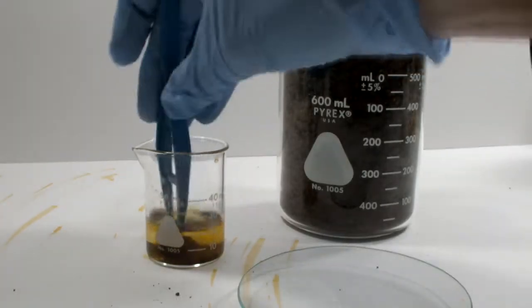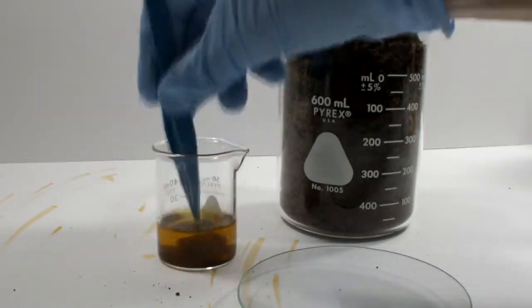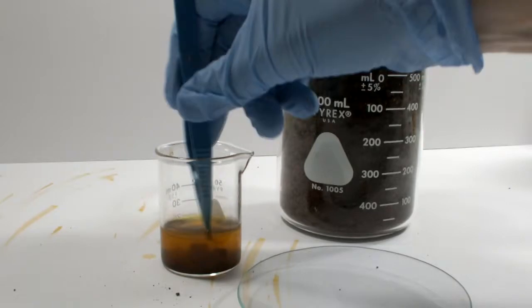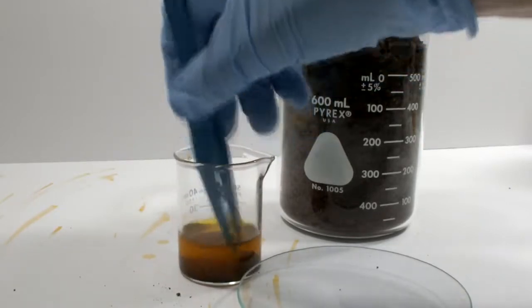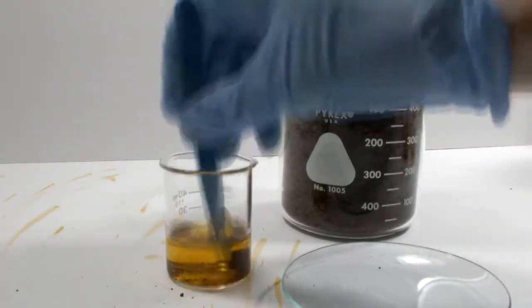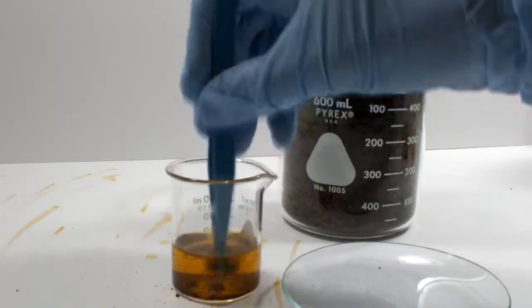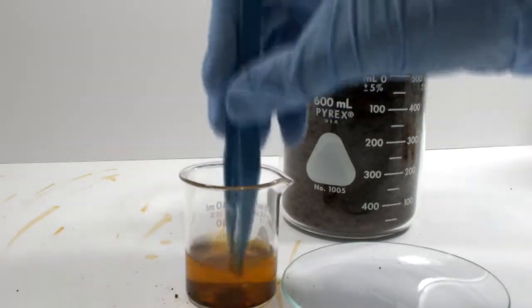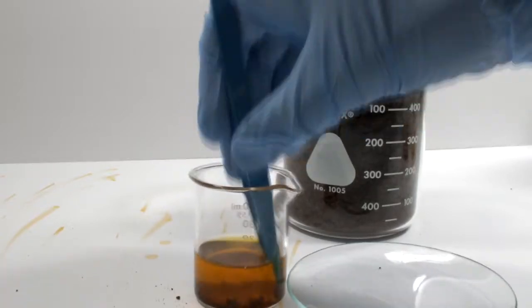It does seem to disintegrate a little faster in the 80% alcohol. I ended up using a little bit of water on both of these trials, and I found that the pieces aren't hiding anything good anyway. Which doesn't really matter at the moment. If I can't even get the gunk out of the way, it doesn't matter how slowly the iron chloride would dissolve. I'm not going to waste my time fighting with it. I'm getting similar results with 70% isopropyl alcohol.